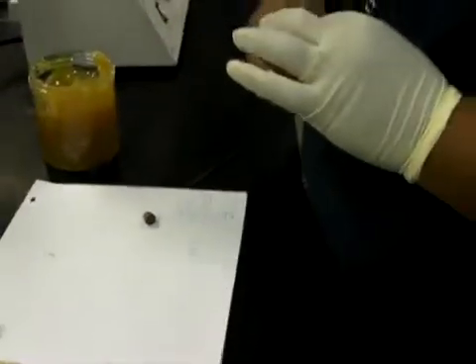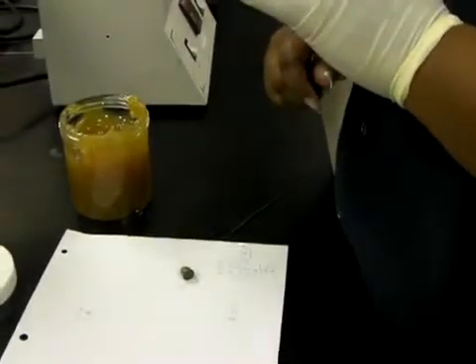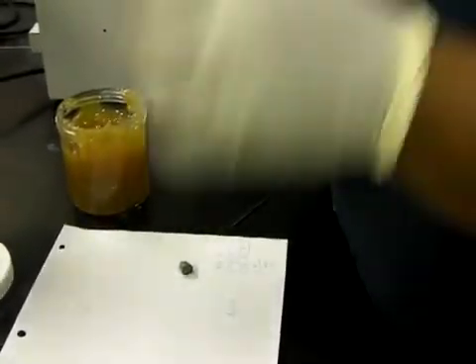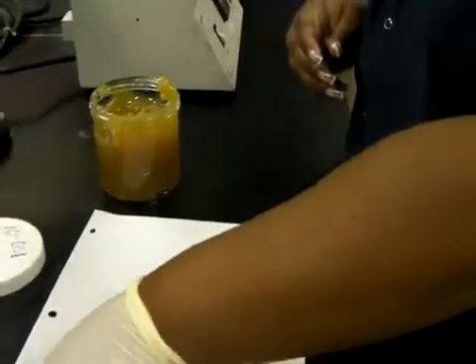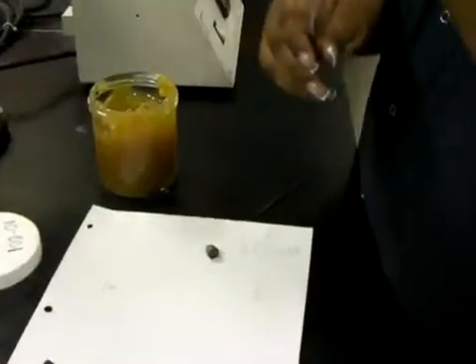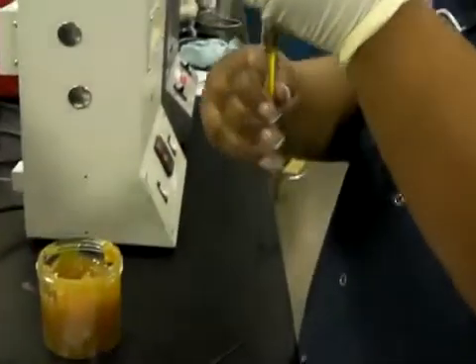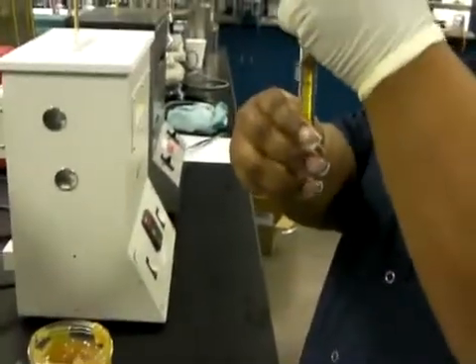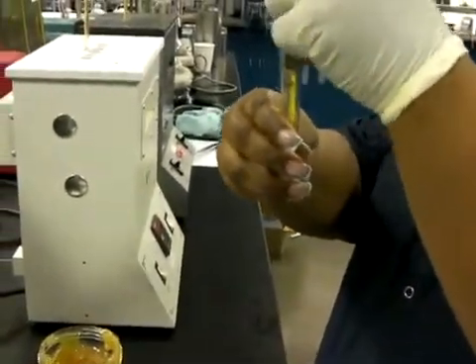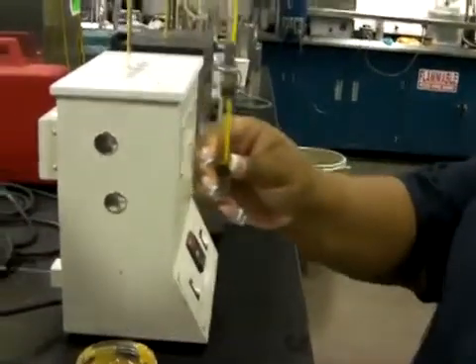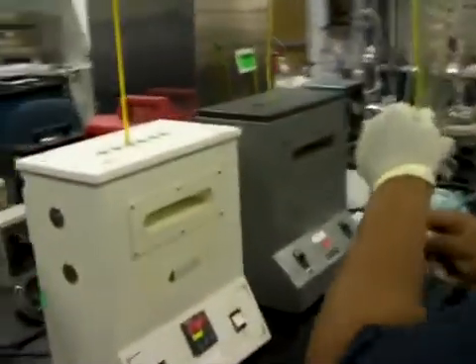Now, there's very little grease in there. After you fill it, you squeeze most of it back out again. You assemble it into this little test tube arrangement with a thermometer, and you stick it into the oven.